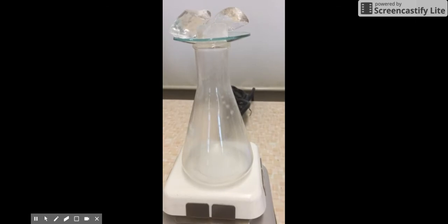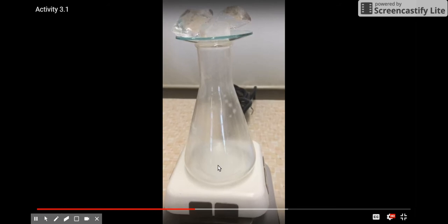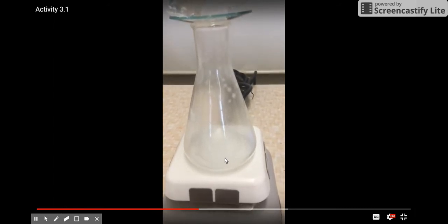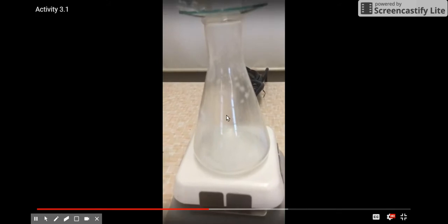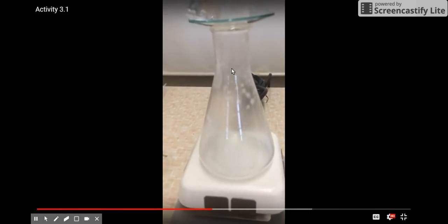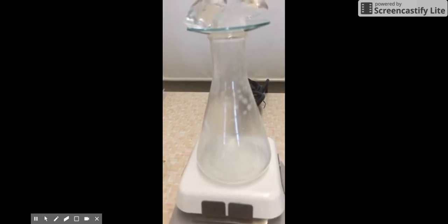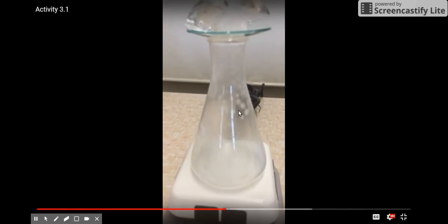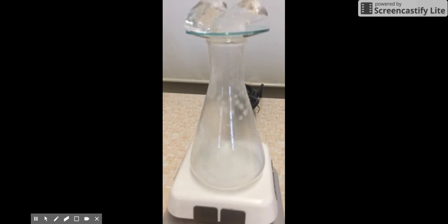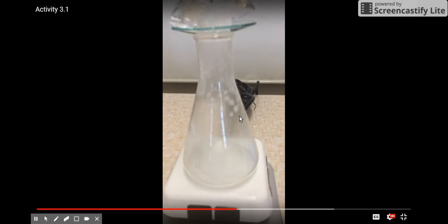The coolness at the top and the heat at the bottom is going to change what was once a solid that was heated into a liquid, heated hot enough to turn into a gas. That coolness at the top is going to change that gas back into first a liquid, condensation, and then a solid. As we're watching the sides of this flask, notice that where it was once cloudy, you can start to see little specks of crystals reforming.